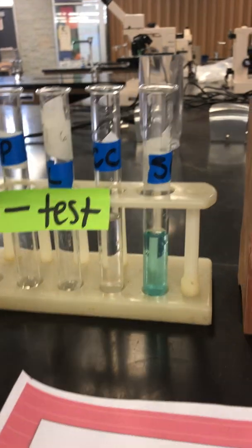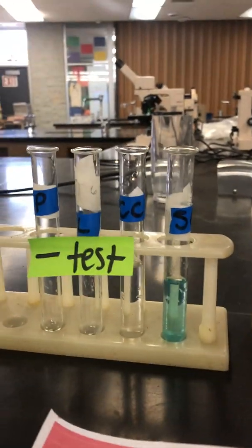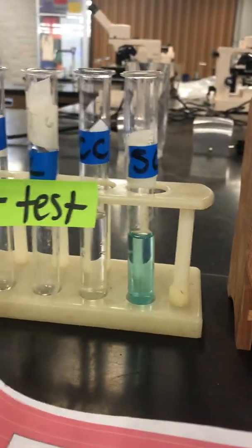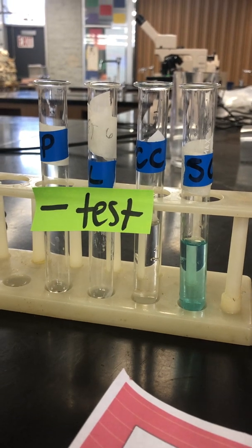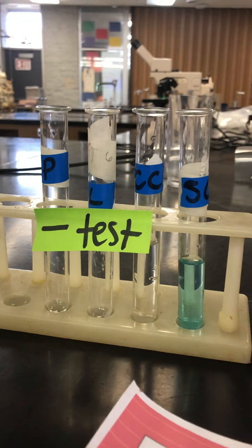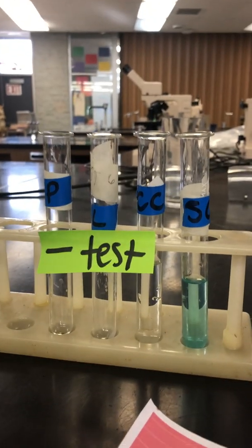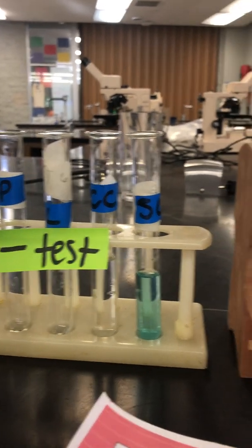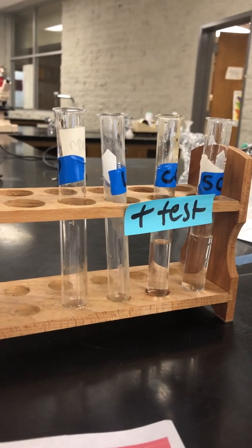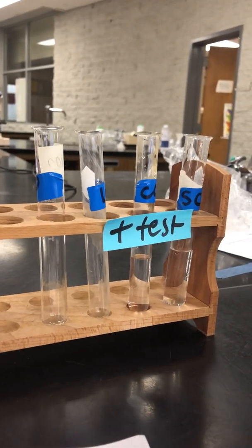For example, let's say that I'm testing the stomach contents and I get a nice blue color for whatever macromolecule I'm testing in here. I would know that that macromolecule is not in the food sample because it matches up with what a negative test looks like, with what something that doesn't have any of that macromolecule looks like. And if I got a sample that matches up with something over here, I would know that my stomach sample does have that macromolecule in it, and it will lead us closer to solving the case of Harold's death.